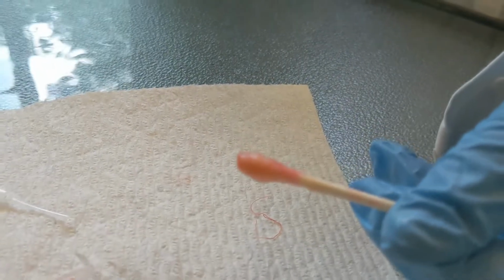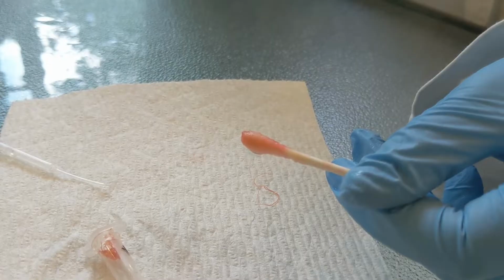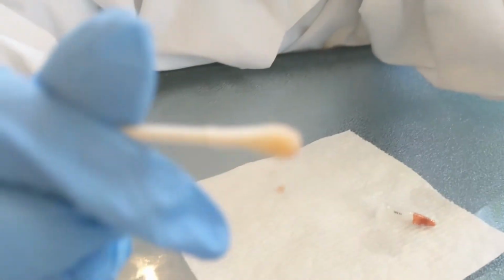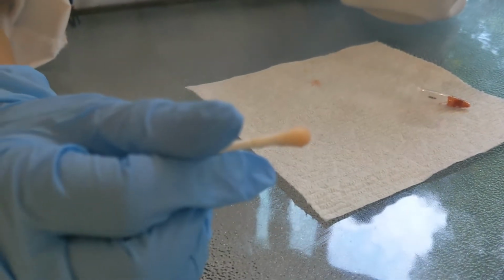Okay. Yours is the positive. Hold still. So yours is the positive control. Who had the negative control? Definitely me. It looks like you, Taylor, had the negative control. So that should not have turned, and it didn't. So if yours looks more like Lily's, it's positive. And if yours looks more like Taylor's, it's negative.